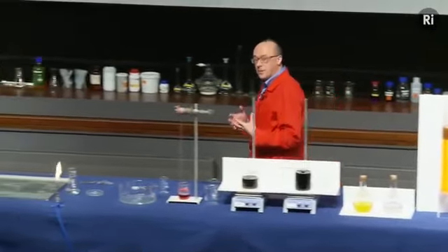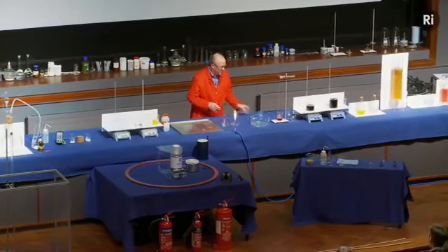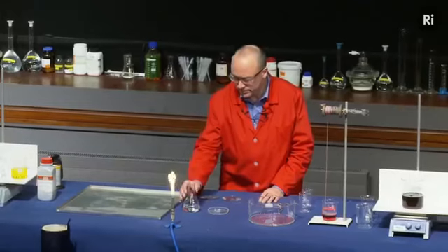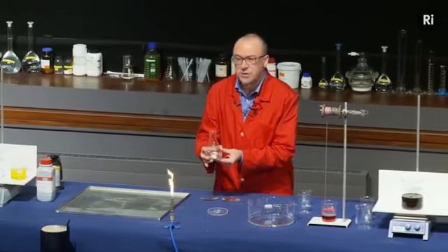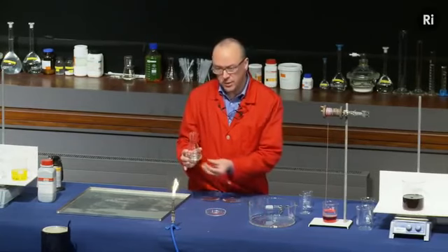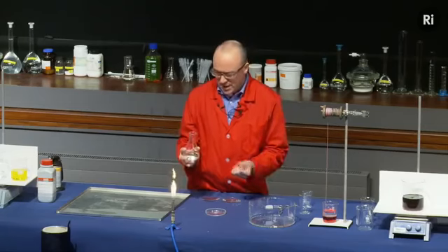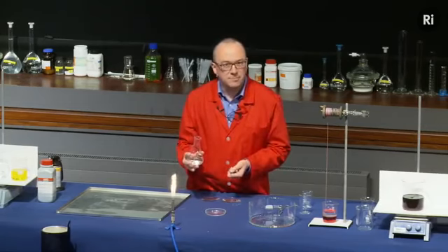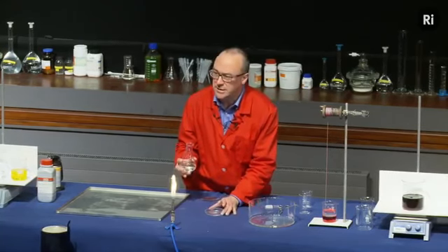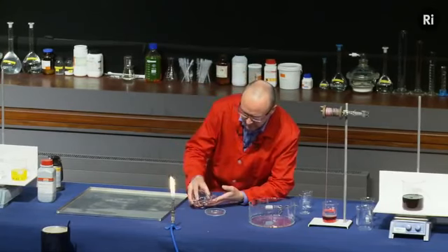Okay, so that's an example of a chemical reaction that produces a change of state. I want to show you another example of a chemical reaction. Again, this is going to go from being a liquid to being a solid. So in this flask I have a solution of sodium acetate, and this sodium acetate's a liquid, as you can see, but it would very much like to be a solid. It would like to turn into a crystal. But it needs a sort of an excuse to get going. And the excuse is going to be some little crystals of solid sodium acetate in this dish. So watch what happens as I pour the liquid onto the crystals.